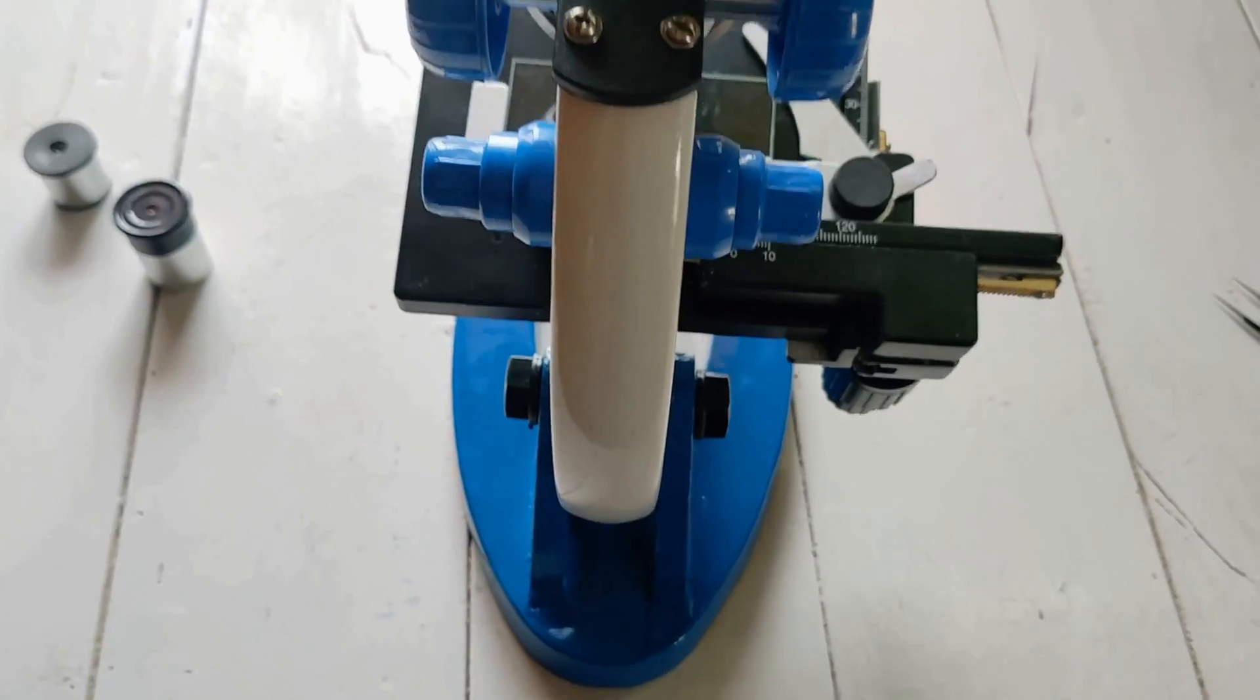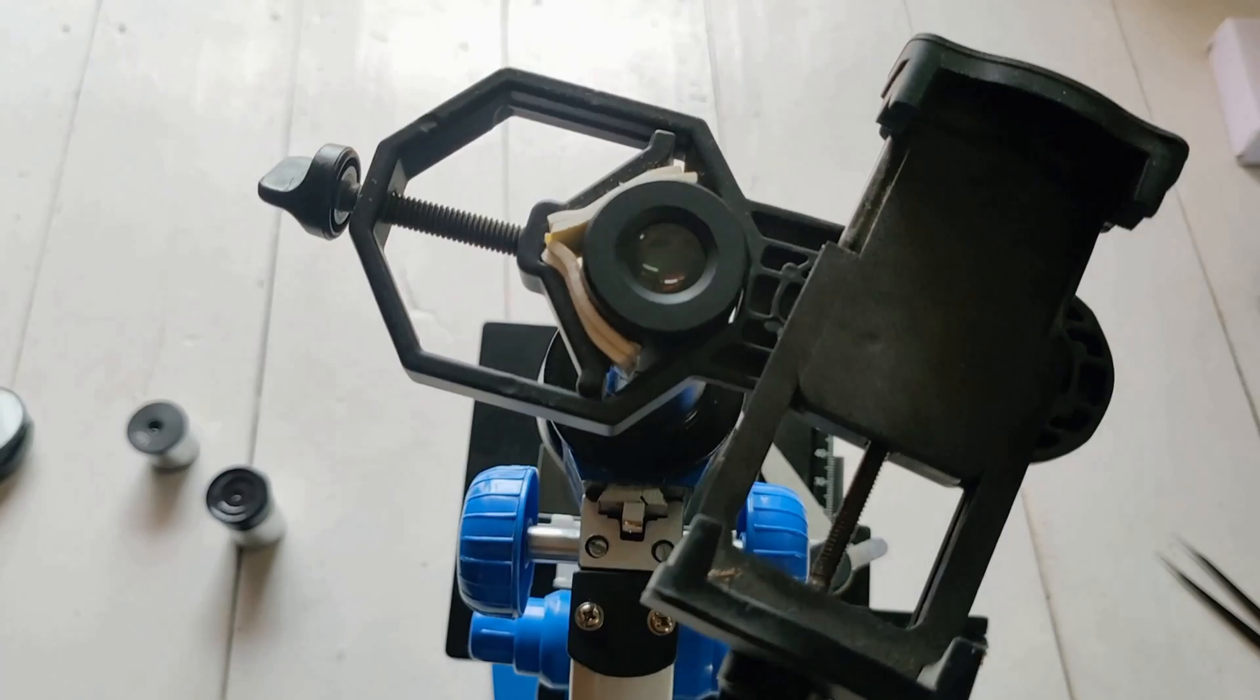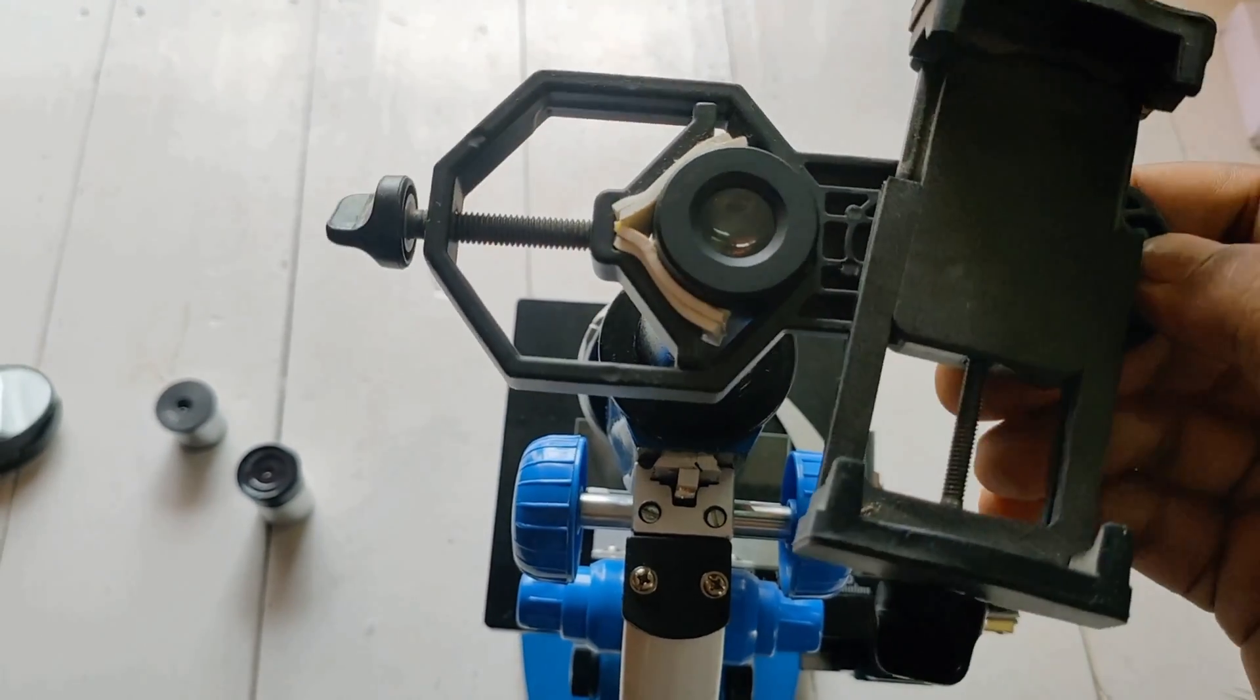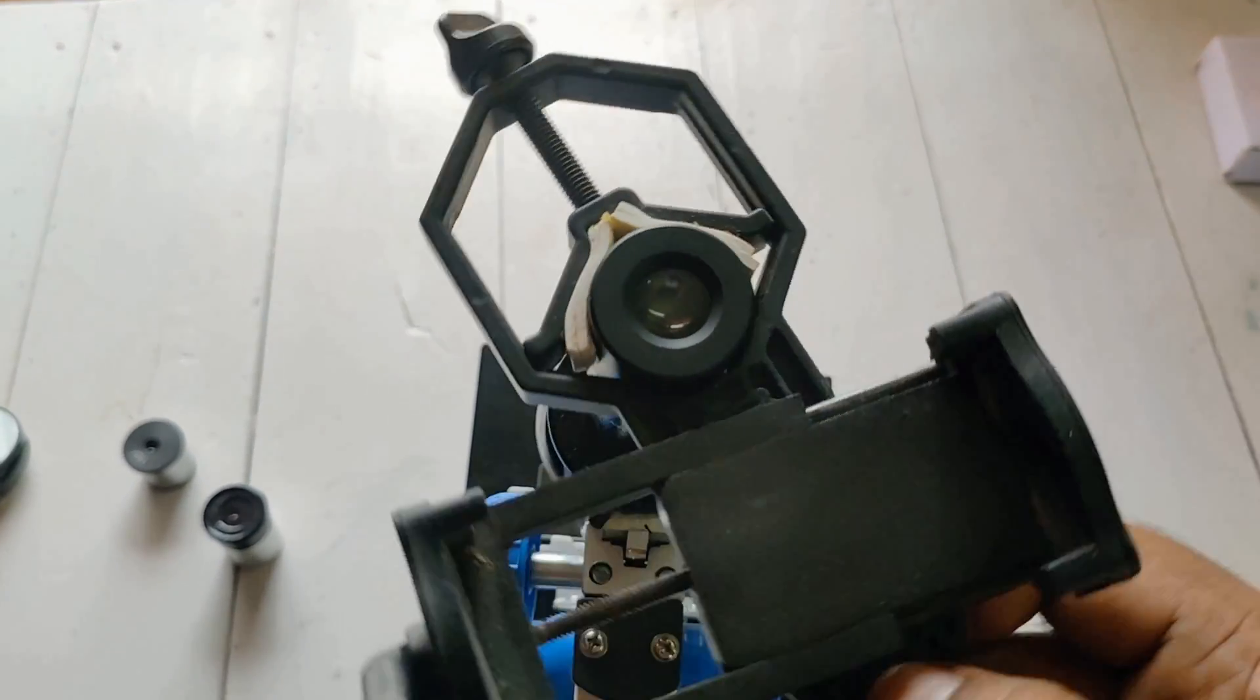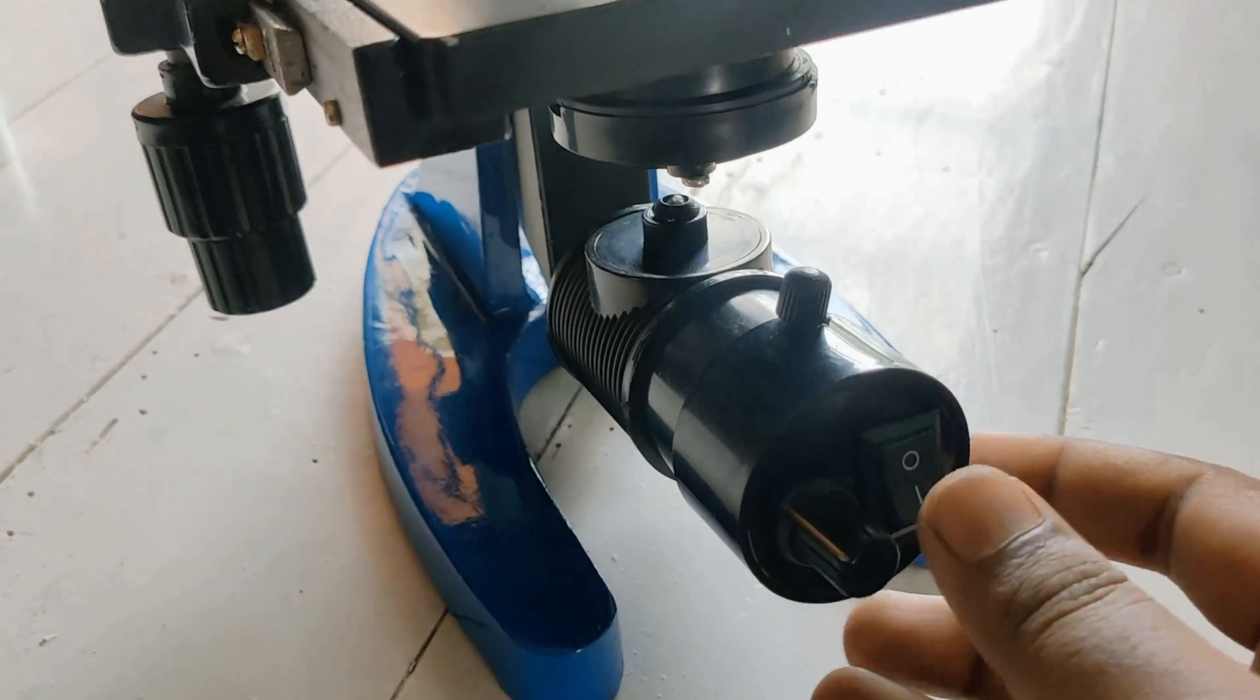Along with this microscope, I'm using this mobile holder to capture video or photos with my mobile. It's really helpful for both telescope and microscope. Here I attach the light.